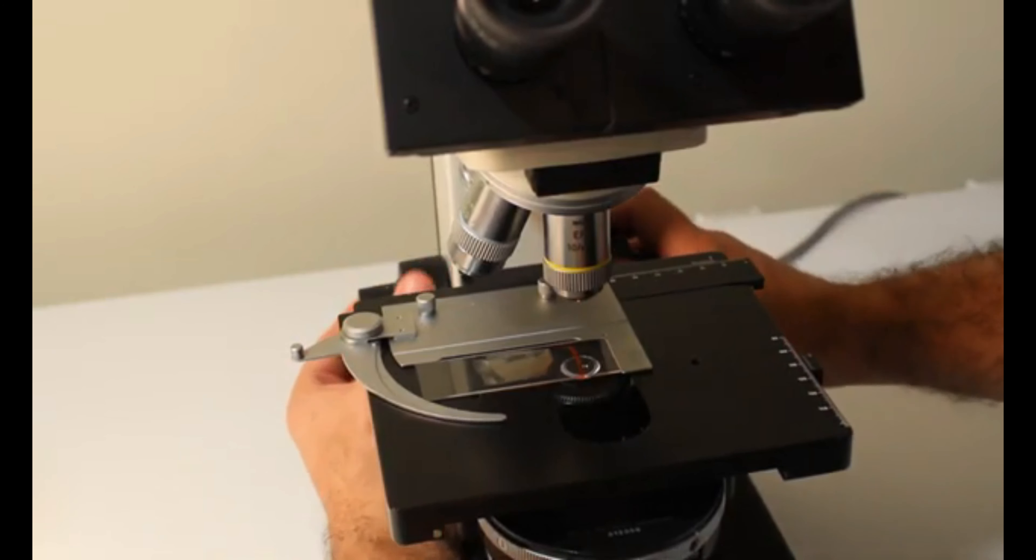When focusing, be very careful not to ram the sample into your lens as this can scratch your lens and permanently damage it. Once you've focused on the line, it is now easy to use your stage controls or to move the slide manually to bring the sample into the field of view.